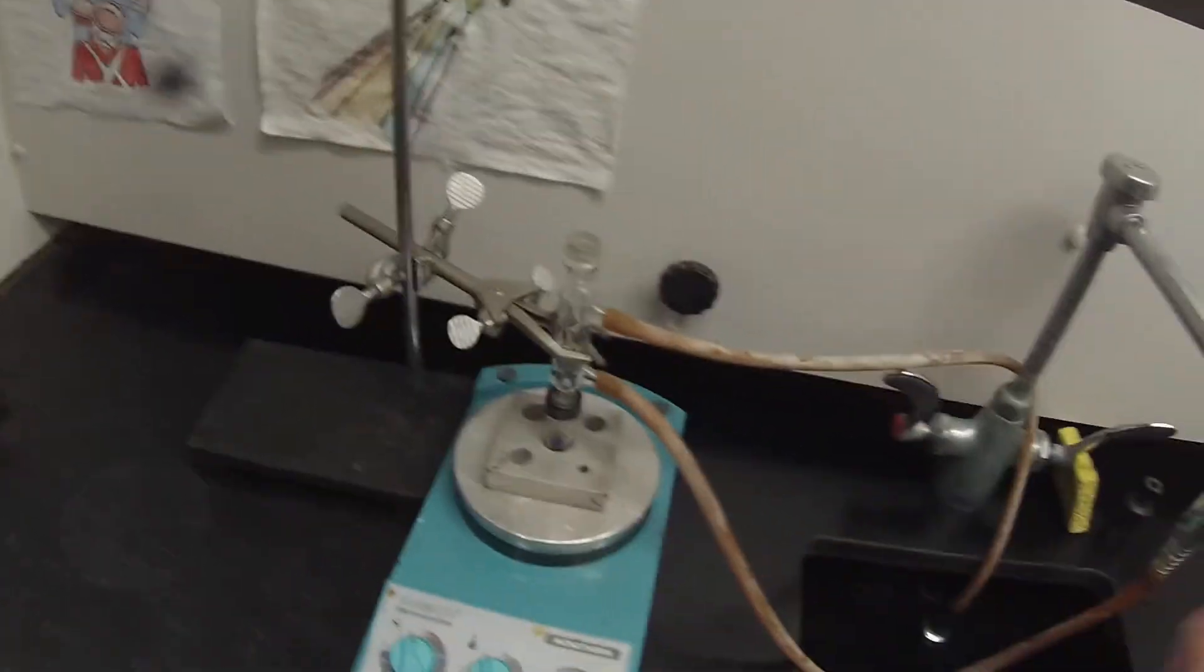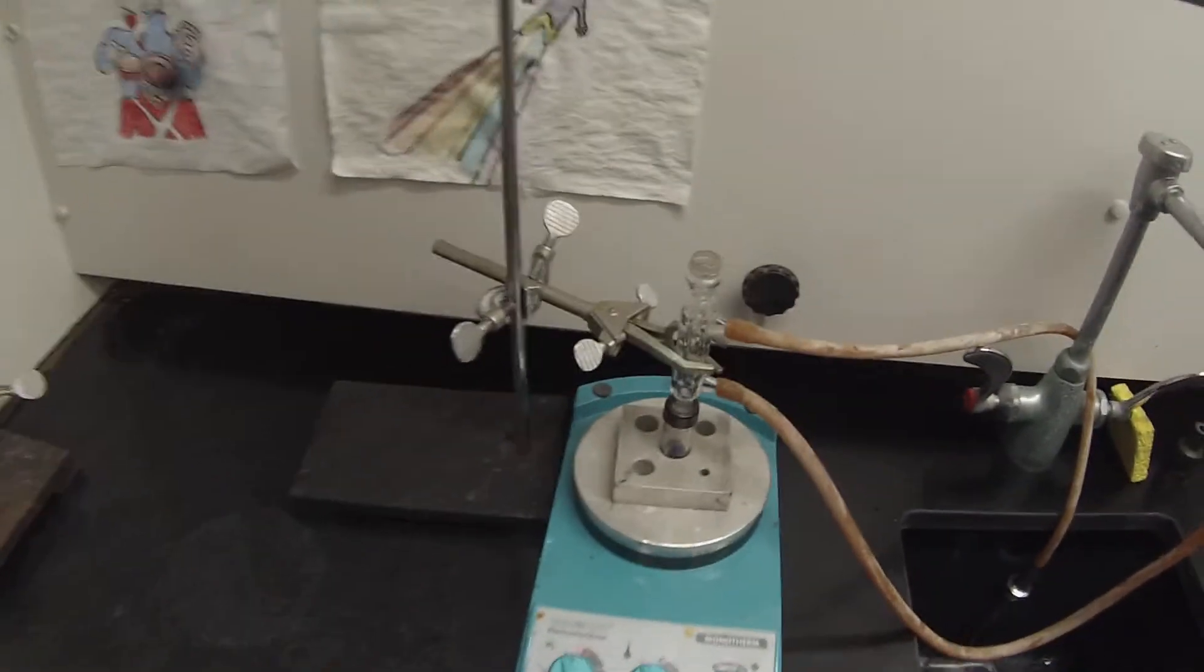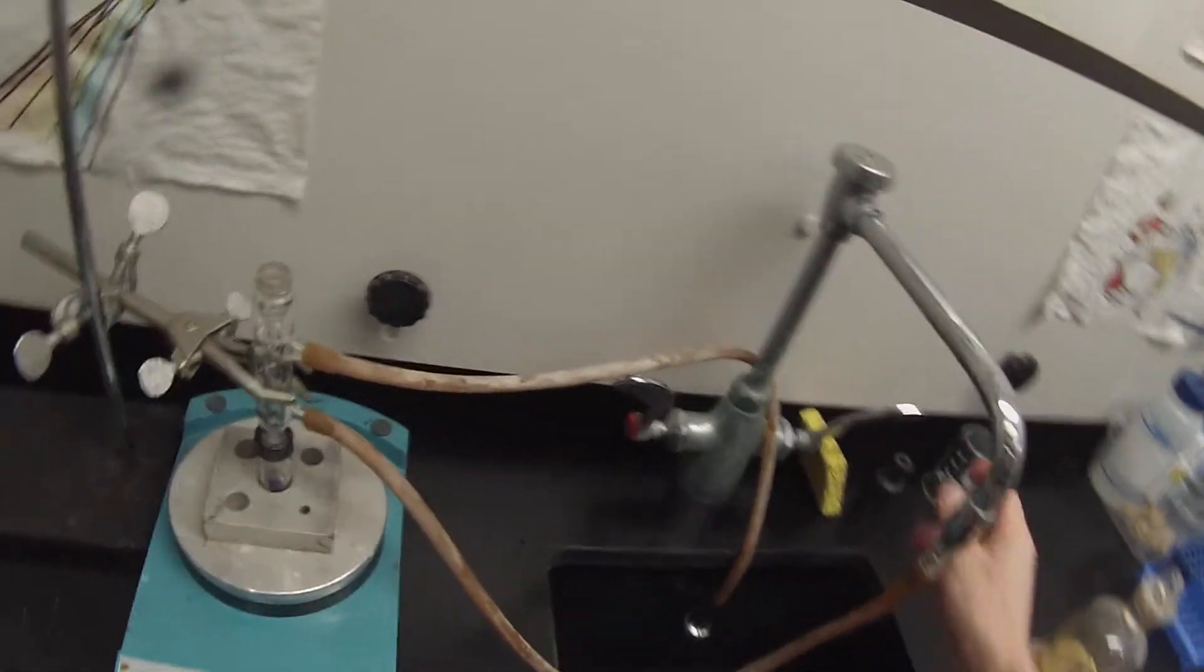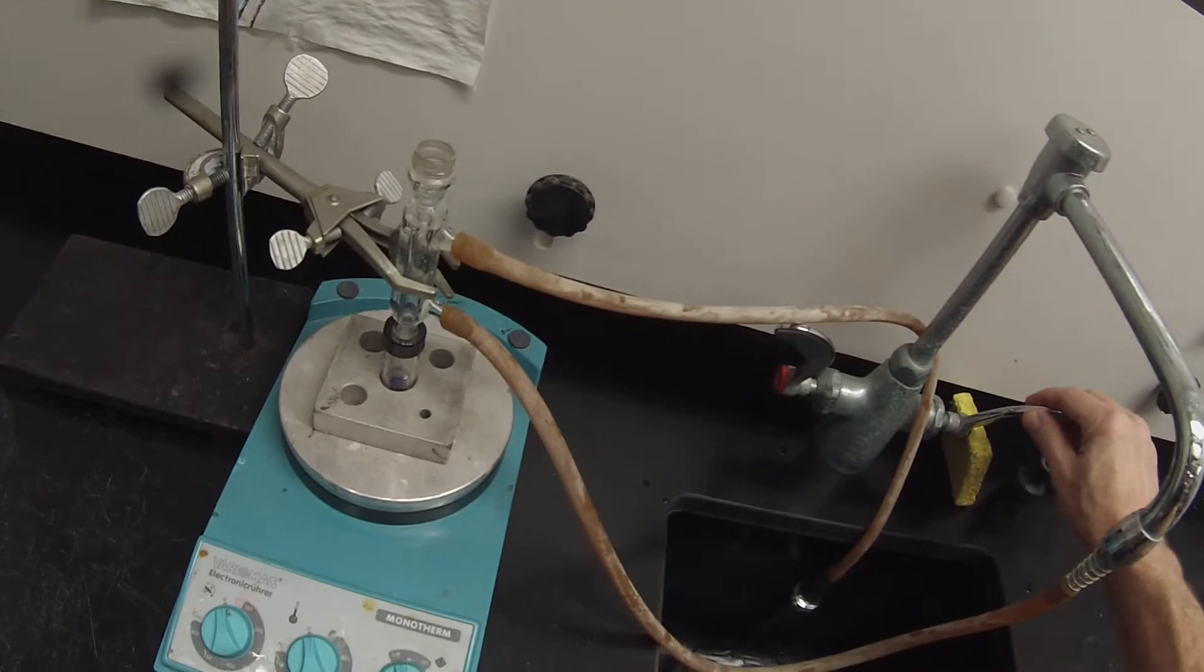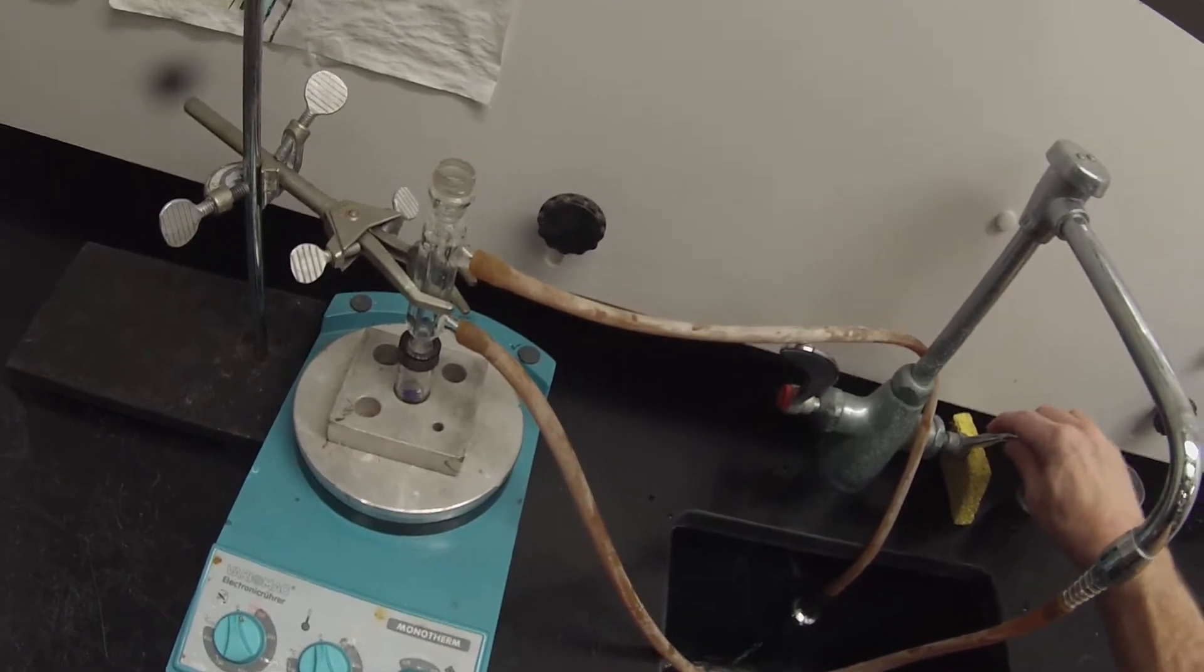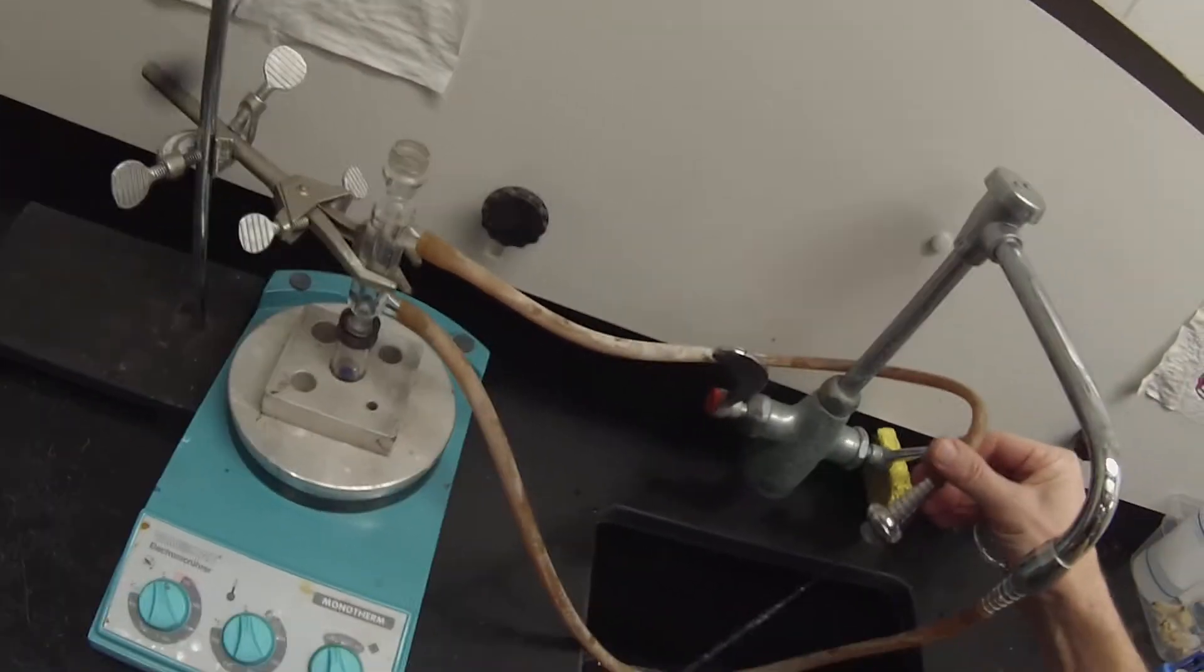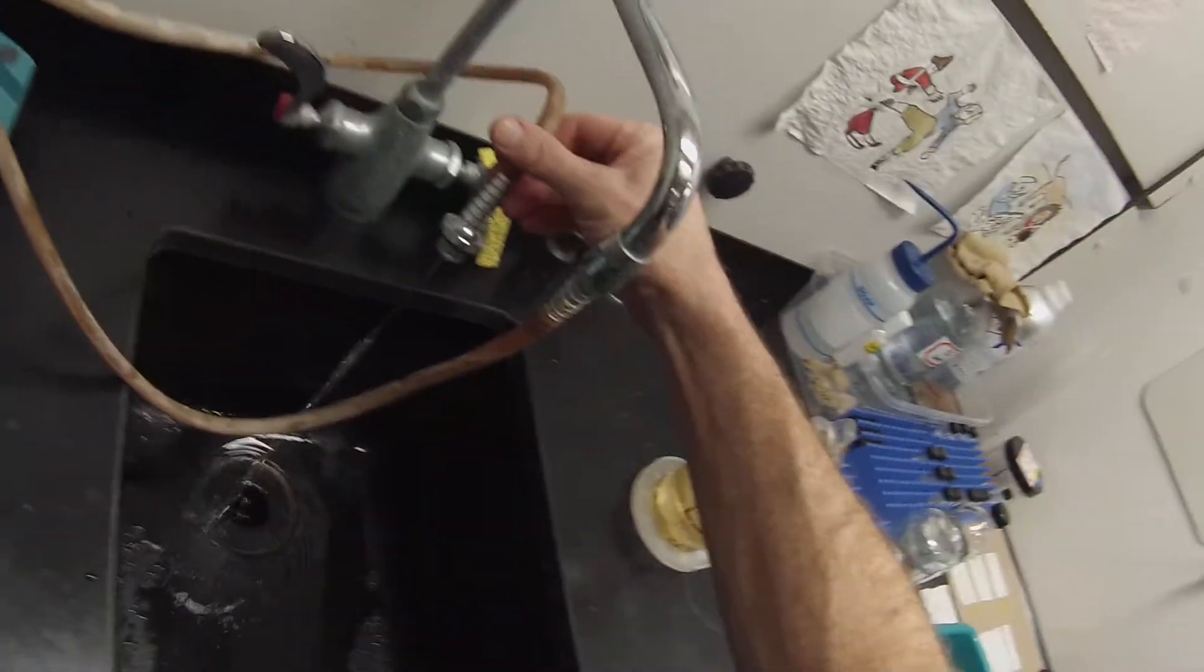And we can turn that on, get a nice flow rate going. So there's our assembly, and we can go ahead and leave that water running. We don't want it running really fast. It seems like a nice flow rate. Looks pretty good.